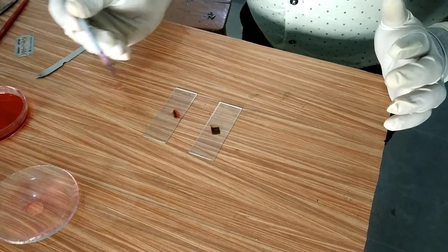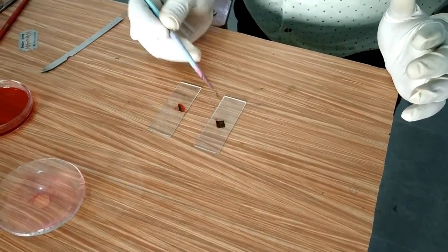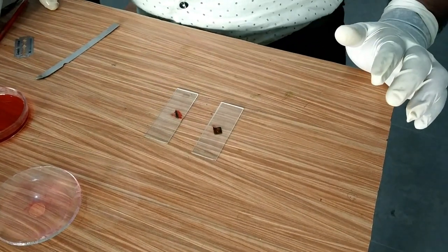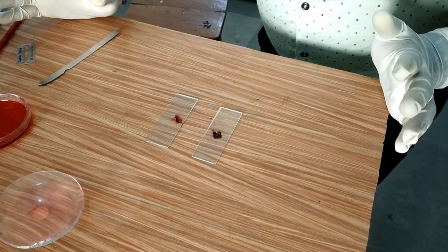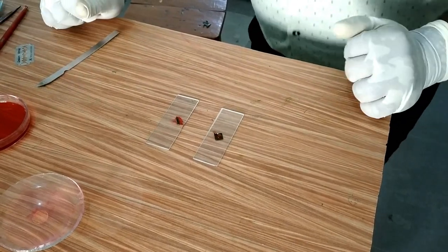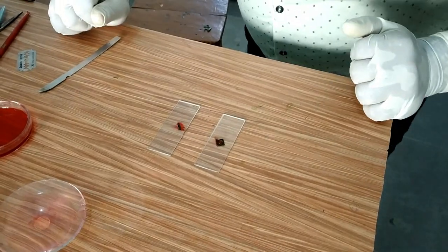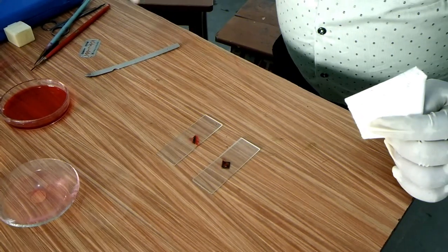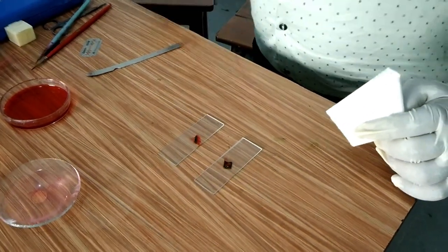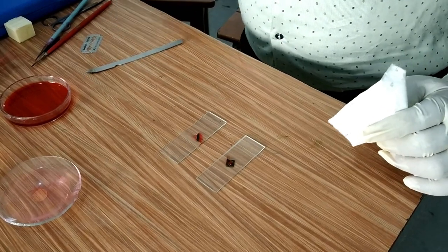Finally, I will use one drop of glycerin on both of the slides to prevent drying and desiccation of the epidermal cells. Glycerin also avoids air bubbles inside the slide.